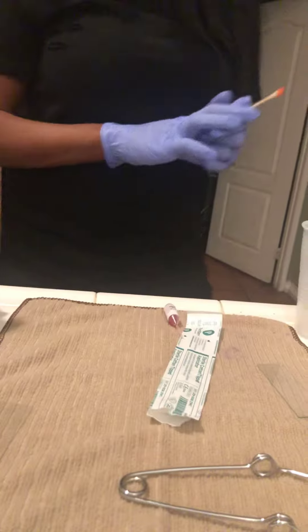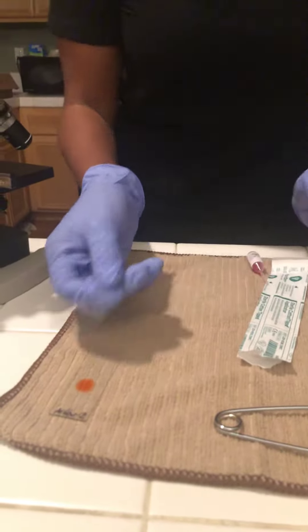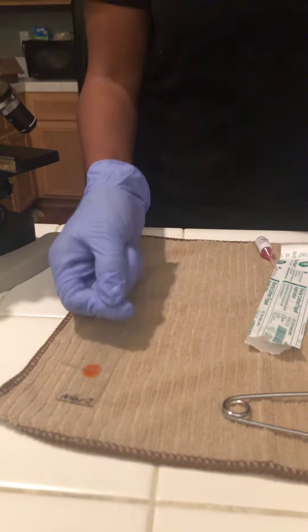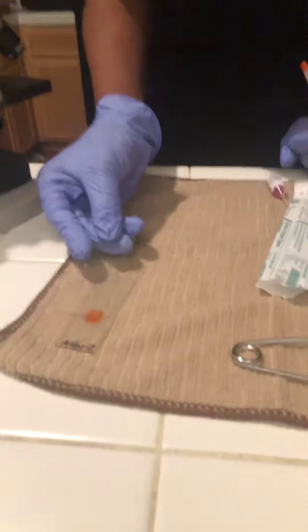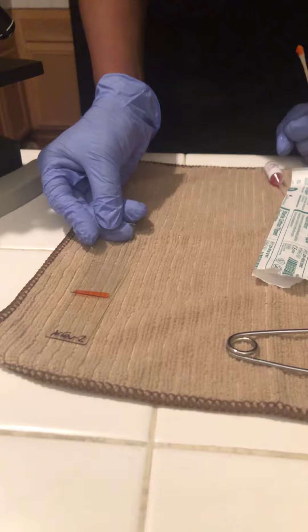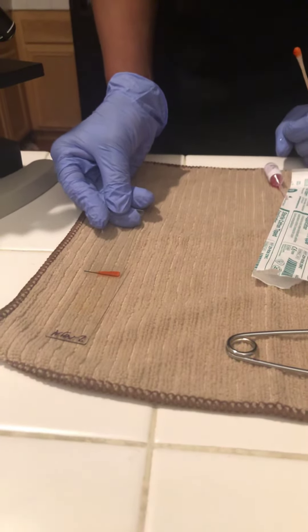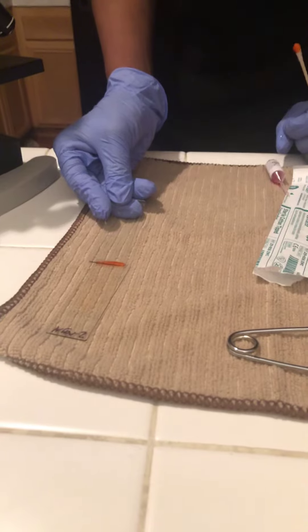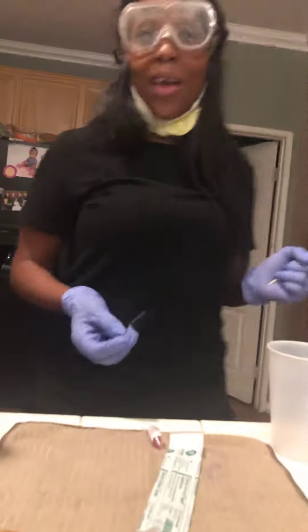Okay, now what I'm going to be doing is taking an extra plate that I have here and I'm just going to start sliding it down so it spreads. Okay, now I'm going to allow it to dry and we will be back.